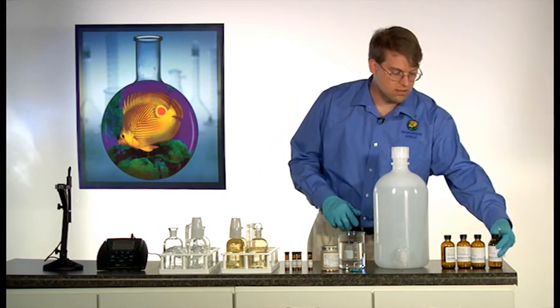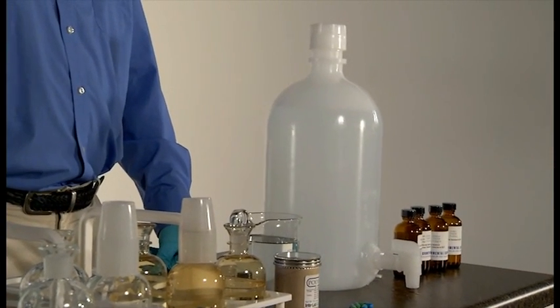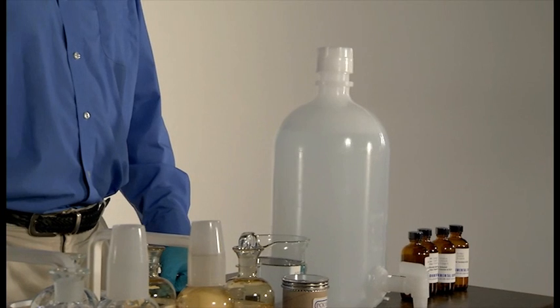After the addition of each of your reagents, you will need to stir and aerate the water. Once this water has been properly aerated, it is ready for use in your samples.